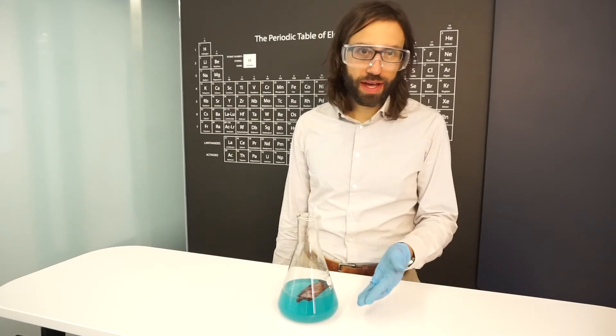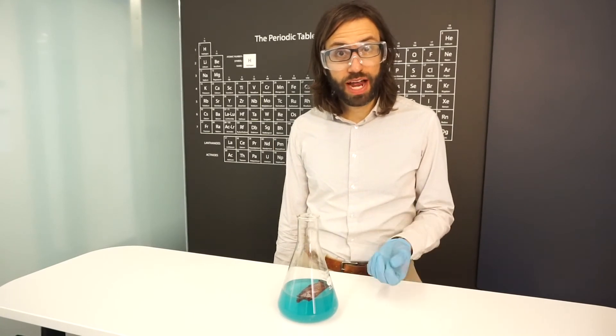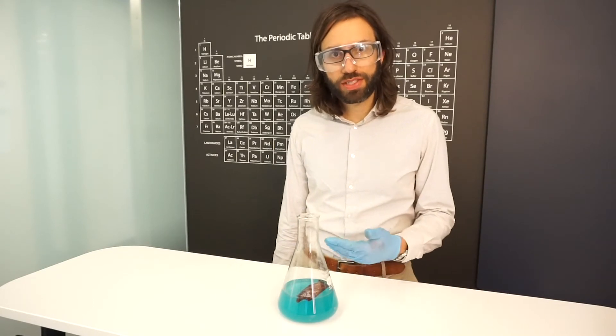We've got the deposition of a red metal that's copper on the surface of aluminum. So the galvanic displacement reaction that we expected to occur has occurred, but only in the presence of sodium chloride.